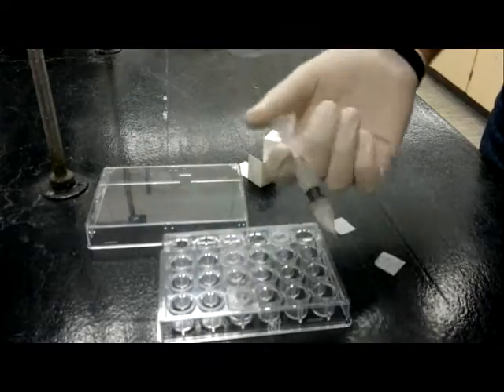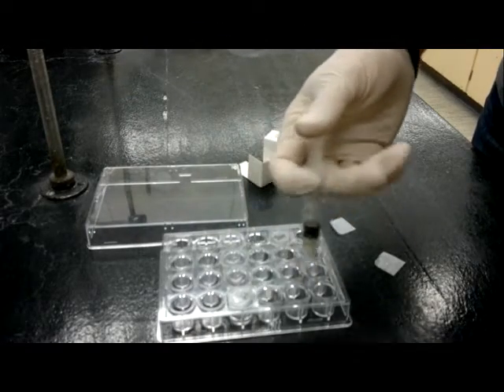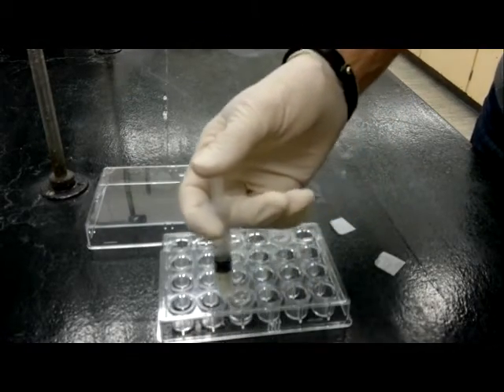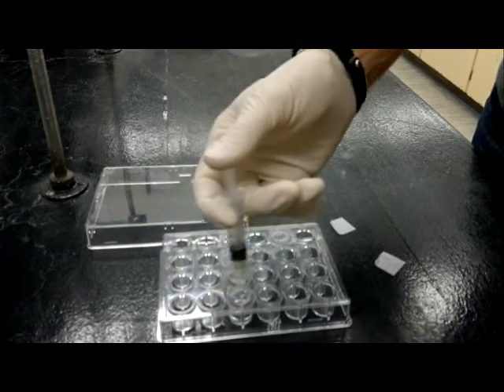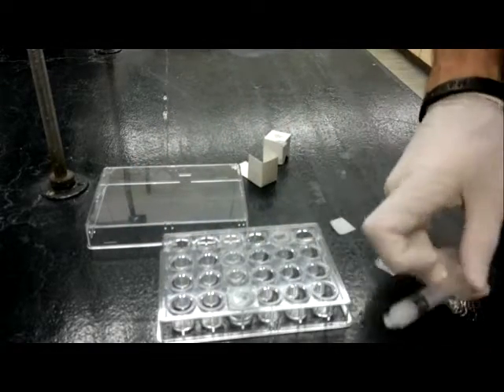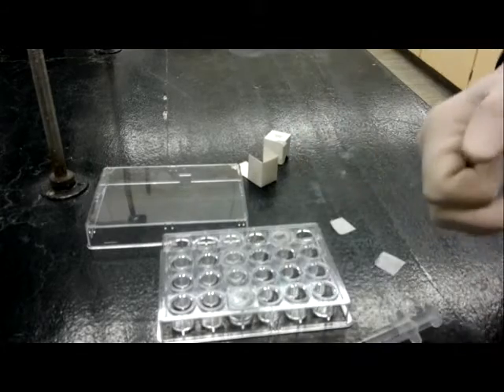If you have a whole bunch of wells to do, what I've found is instead of going around each one separately, it is sometimes easier just to do this kind of serpentine pattern. But whatever pattern you decide works out best, that's how you're going to set up your experiment.